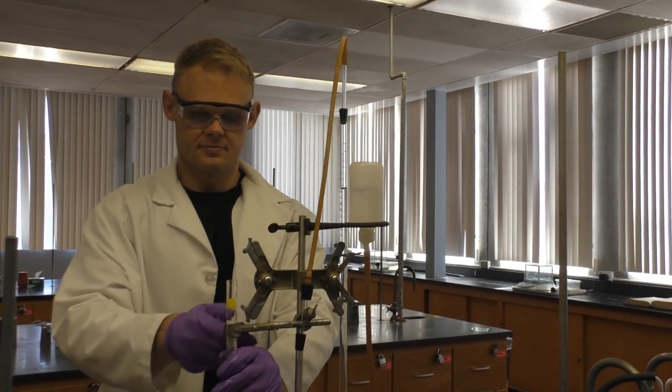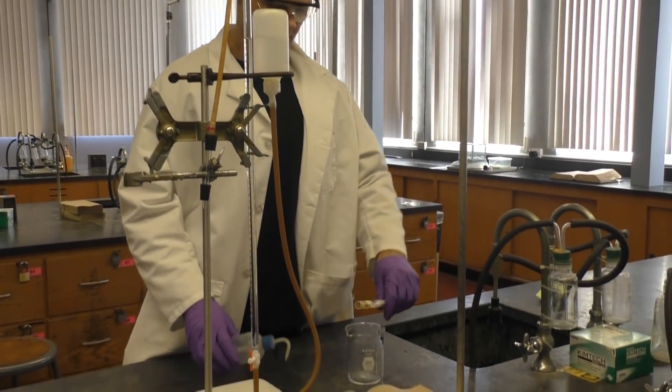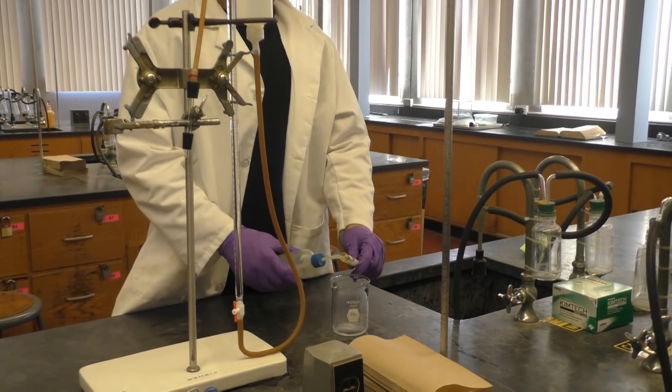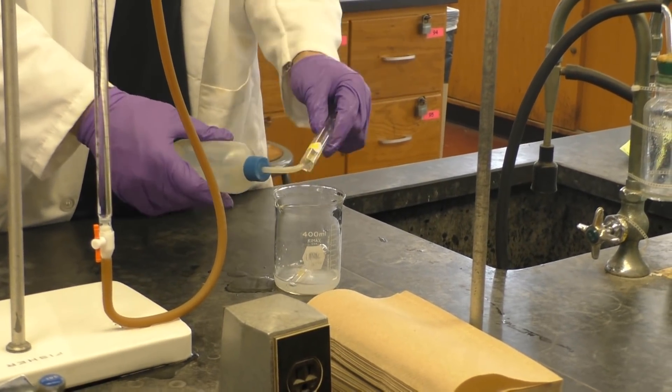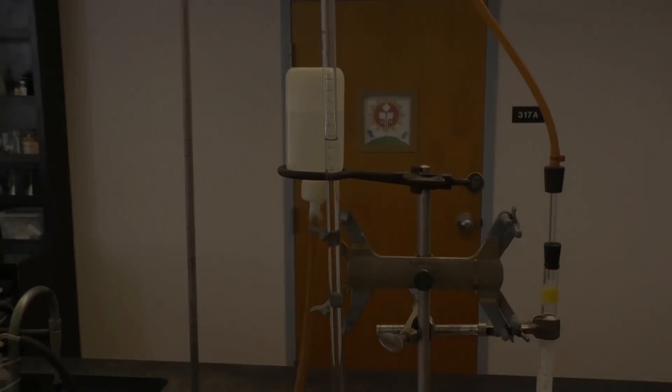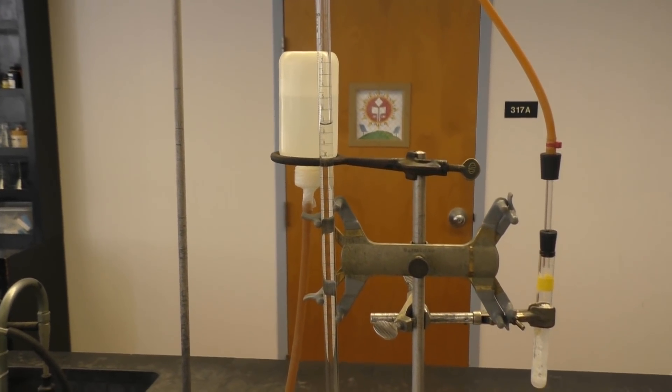Now get ready to perform your analysis again. Dump out your reaction chamber into a waste beaker, rinse both test tubes with water, and then dry them thoroughly. You'll need to repeat your analysis two times for a total of three trials.